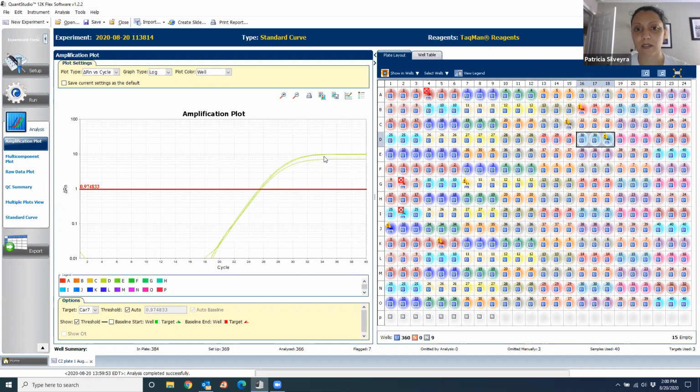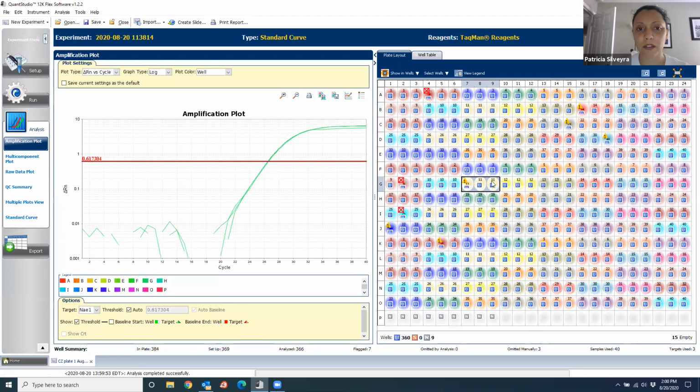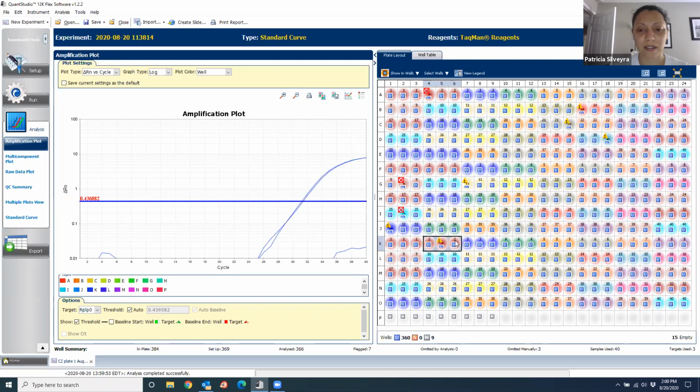See, sometimes it's just this difference, but we only care about what happens here, so you don't have to worry about that. And you can always ask me. I have many years of experience doing this, and certainly I didn't learn everything in one day. All right, so here's another problem.